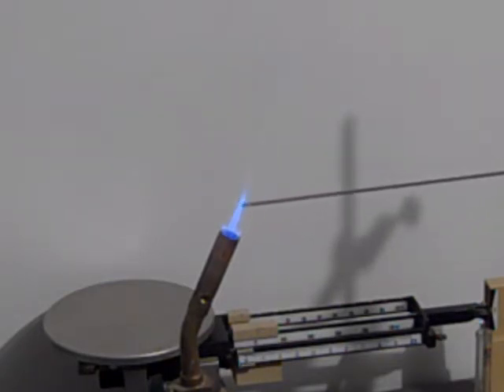And you get like a pale yellow-green, like a pear color. Okay, let me give you then the strontium.